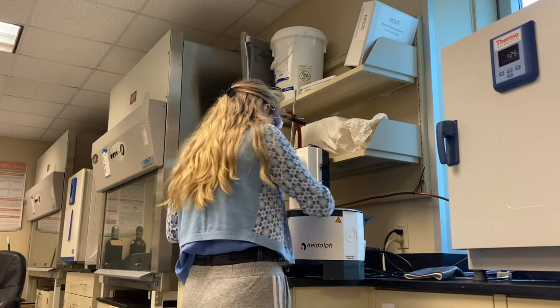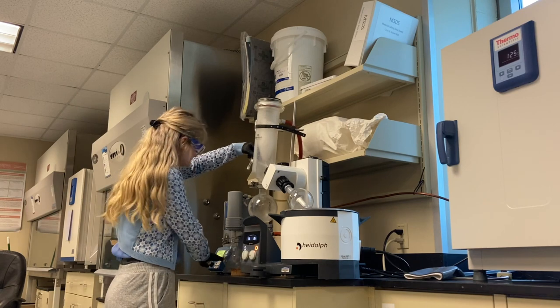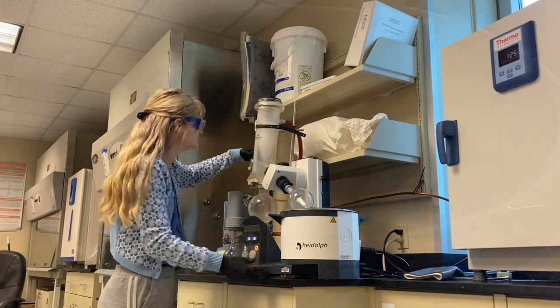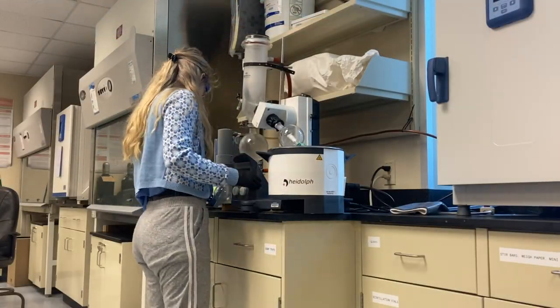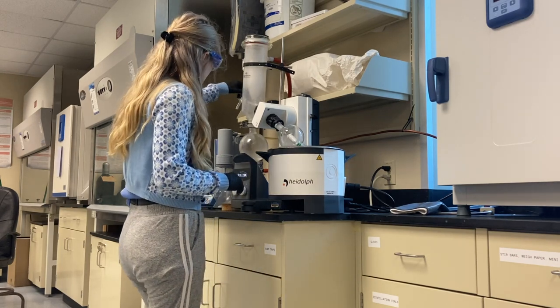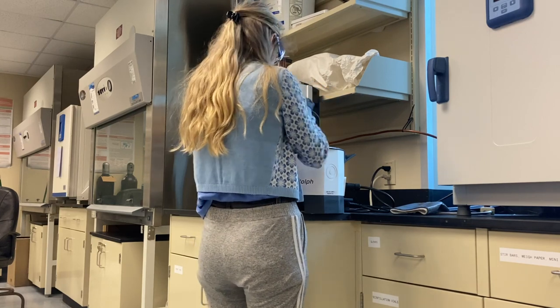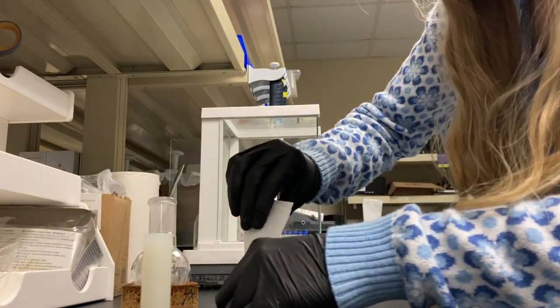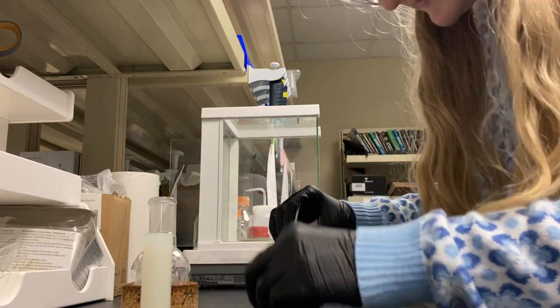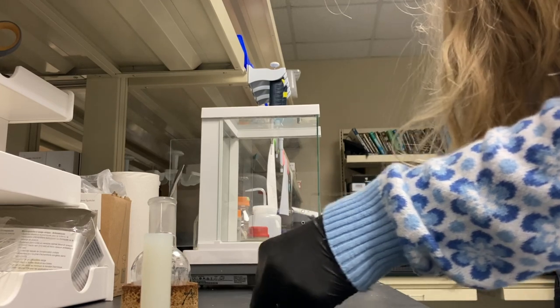After adding in your silica gel, you put your sample on the RotoVap. This instrument is able to evaporate all of your solvent so you are left with a powder. You can see there's a bunch of solvent in there at first, and then over time that solvent disappears, leaving your solid product — which is very effective. The RotoVap uses vacuum to remove the solvent, making the process go a lot quicker. Then you transfer the sample mixed with silica into a little container called a samplet, ensuring all of your product gets onto the column to increase the likelihood of having a pure product.